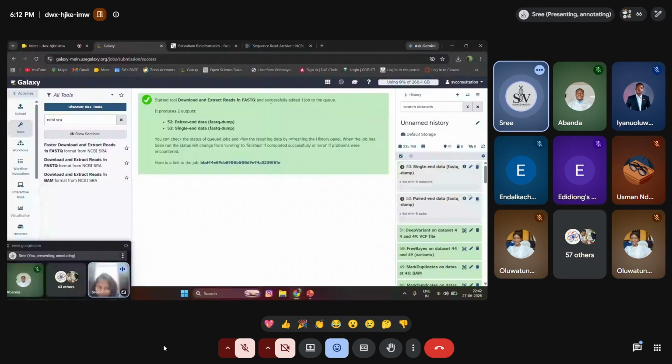It started running. You can see the history over here, where the data we want to analyze has been downloaded into our history in our particular login. While it is processing, it is in this brown color. When the processing is done, it will turn green and provide the results. Or if it has failed, it will turn red, showing that the process did not run properly.